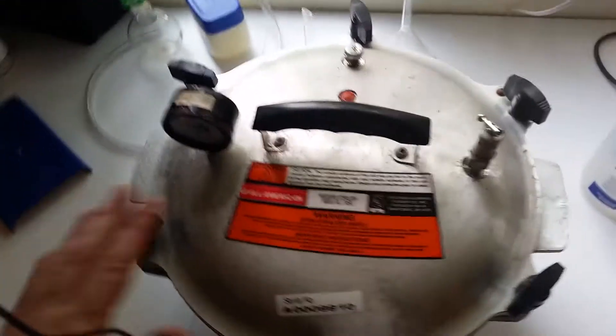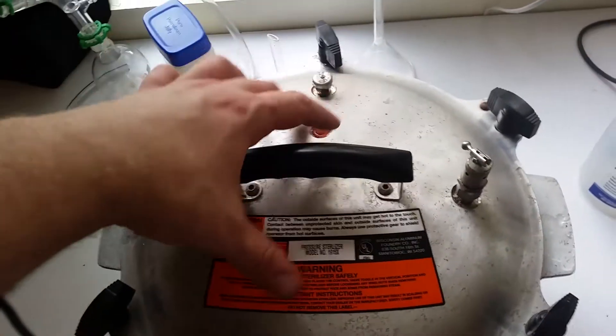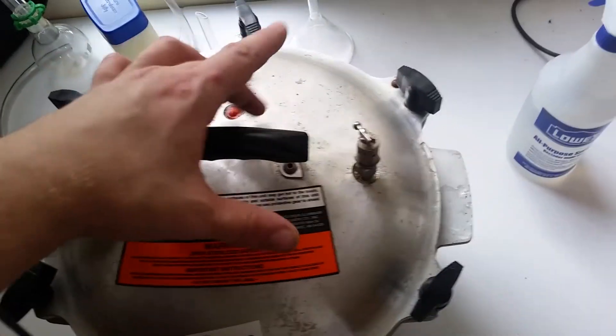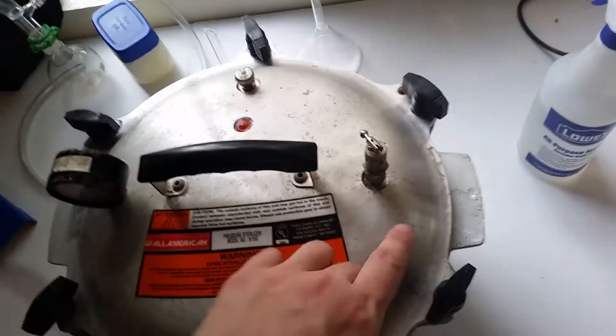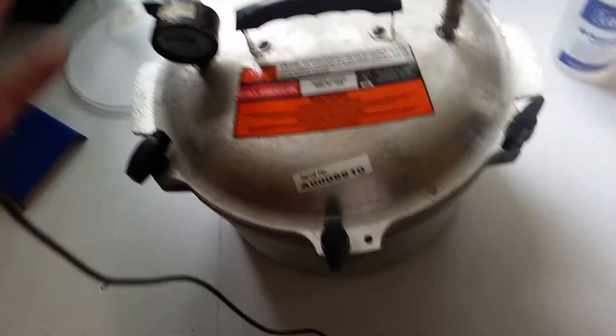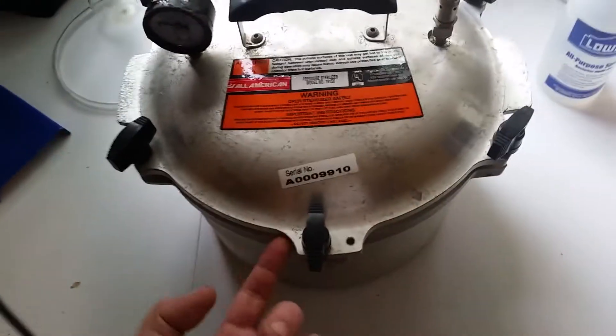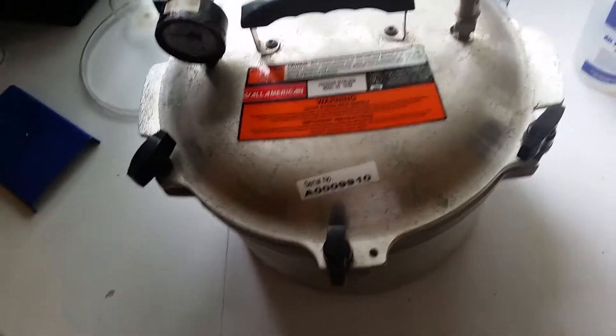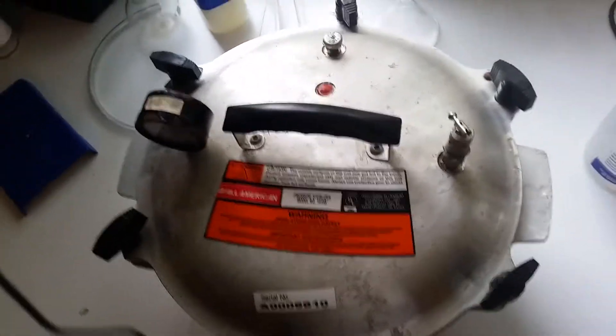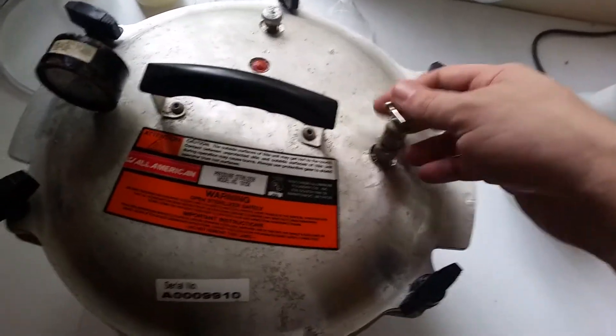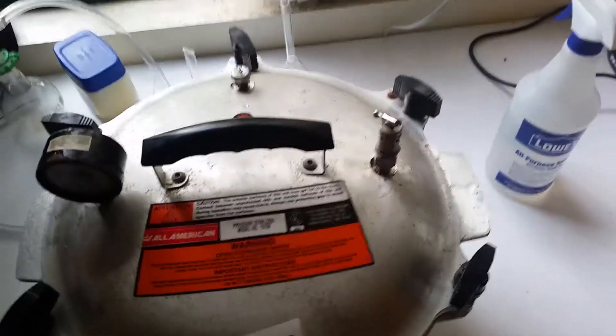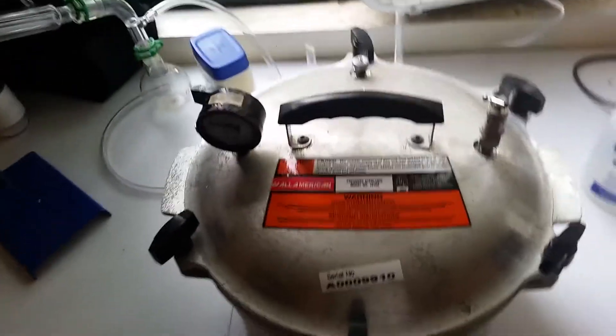Okay, so I was able to get this up to about 10 psi. Putting the petroleum jelly on the plug seemed to have done the trick. I also put a bit of water in there and as well as around the other joints just to see if any bubbles come out if there's a leak. I've obviously got a leak somewhere around the sides here because it's losing pressure. But it stopped at about 10 psi. I did let a bit of pressure out with this because there's a hose that goes to the bottom, and that was to get rid of some of the atmospheric gases that were in there.